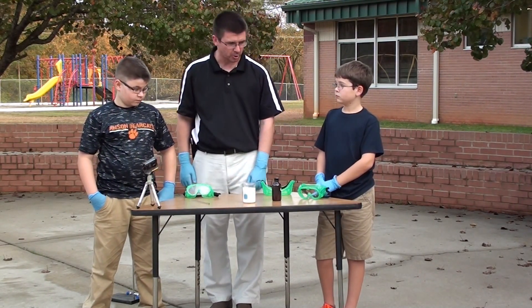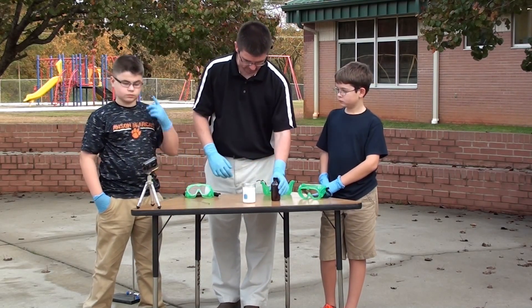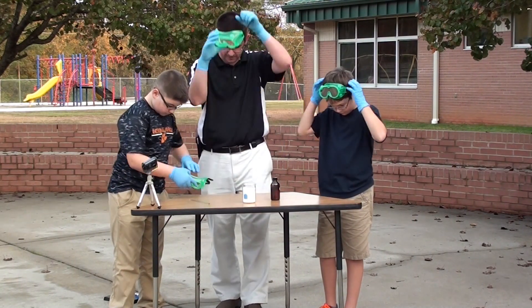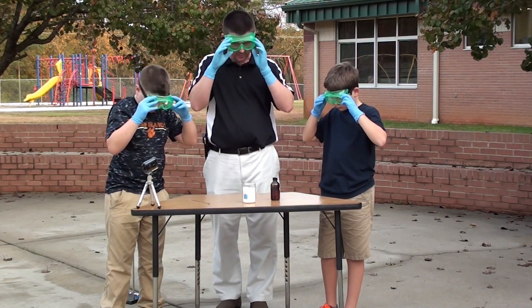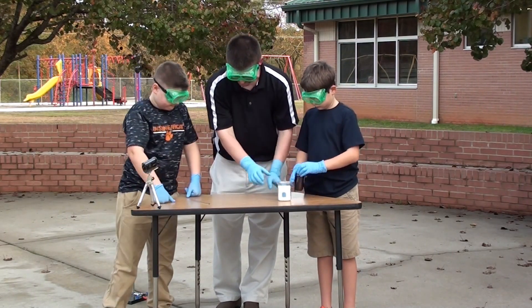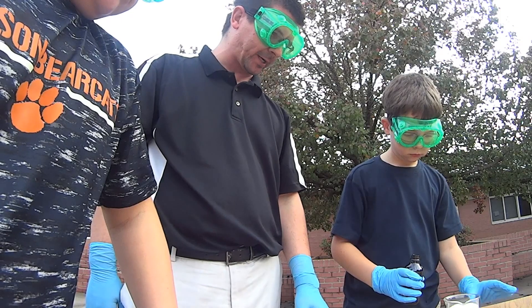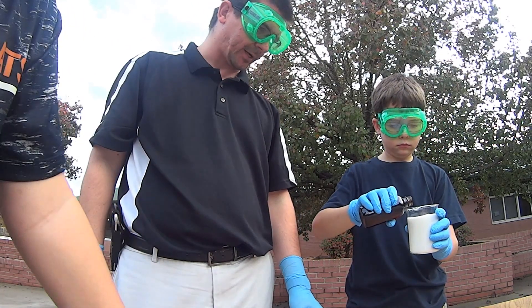I'm going to let you all help out. Lane, do you want to pour the acid for us? Let's put our goggles on first. You can pass it over to Trent and Trent is going to stir it up a little bit. Just be very careful pouring — you can pour the whole bottle, just try not to spill it.